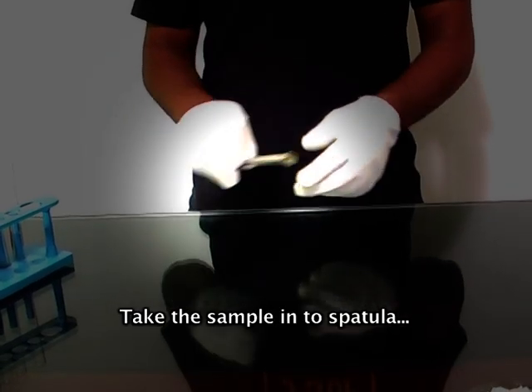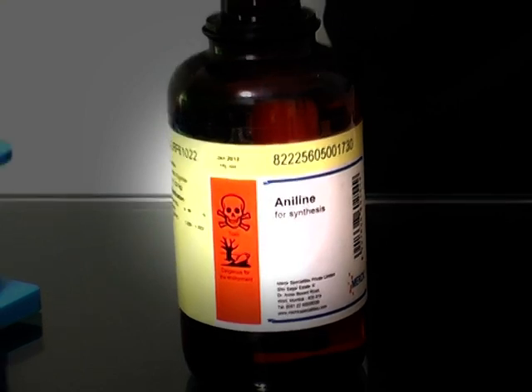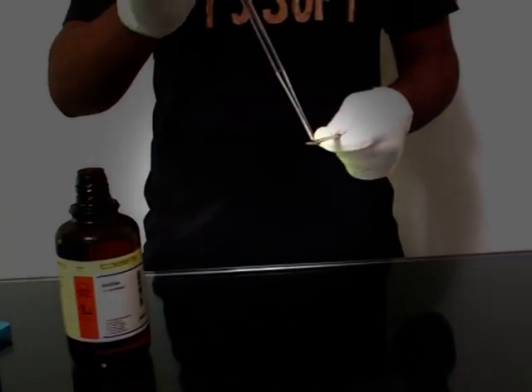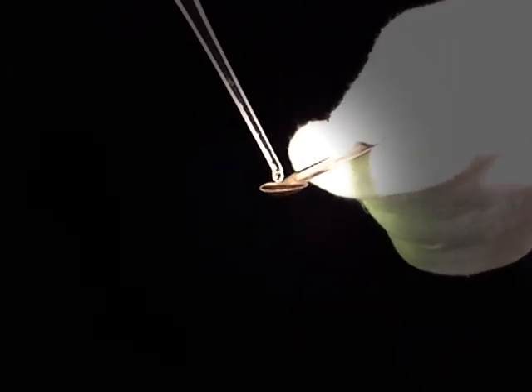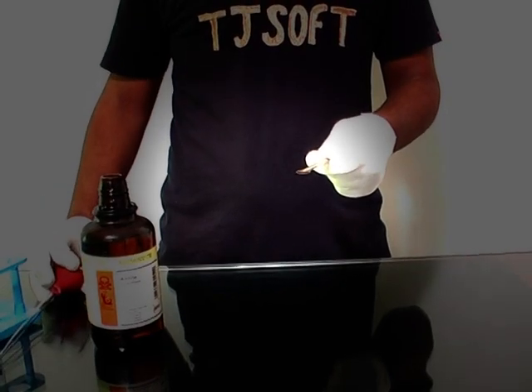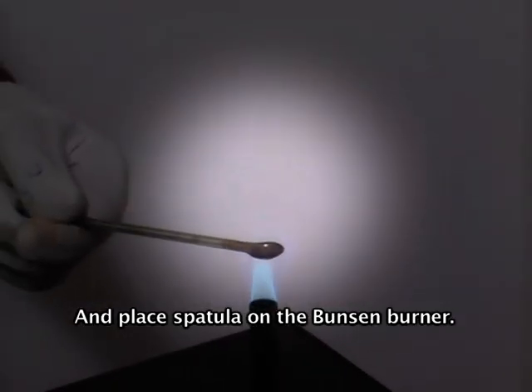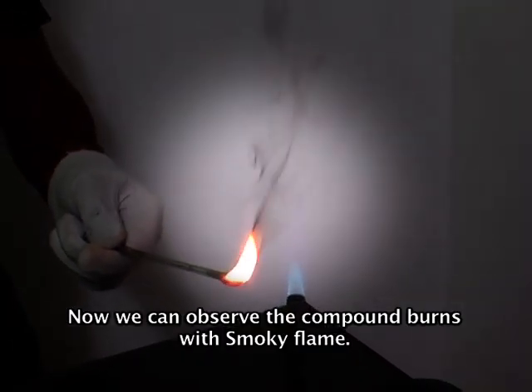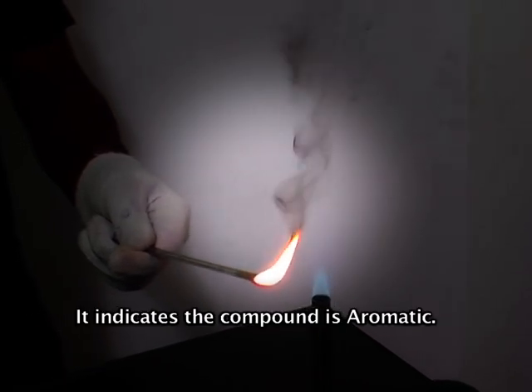Take the sample into a spatula and place the spatula on the Bunsen burner. Now we can observe the compound burns with a smoky flame. It indicates the compound is aromatic.